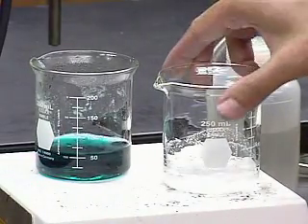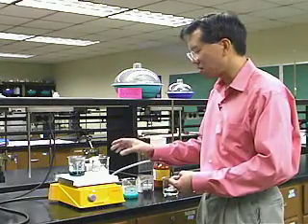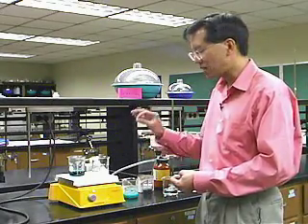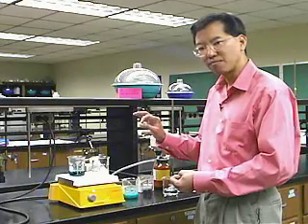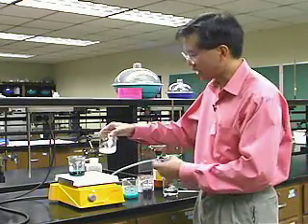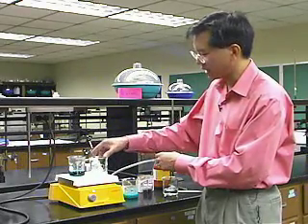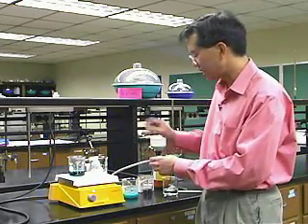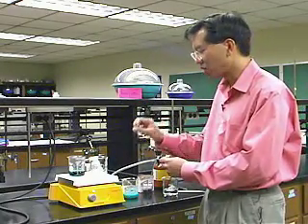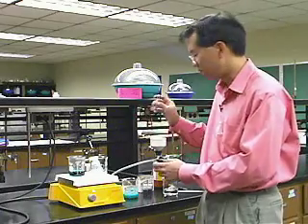and we're going to add just enough water until it's saturated at the high temperature, at 100 degrees C. What does saturated mean? That means that the absolute maximum amount of acetylsalicylic acid has been put into the water, and there's no solid present. I could warm it up on the hot plate here until the water is boiling, and just keep adding little bits of water until I get exactly to the point where I've added just enough water to dissolve everything and no more.